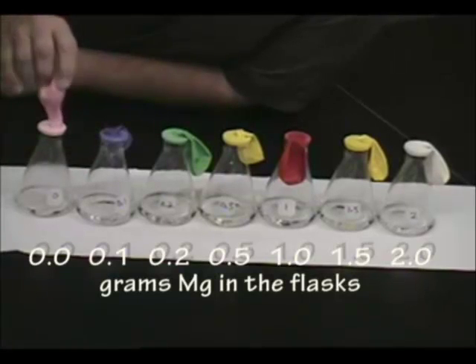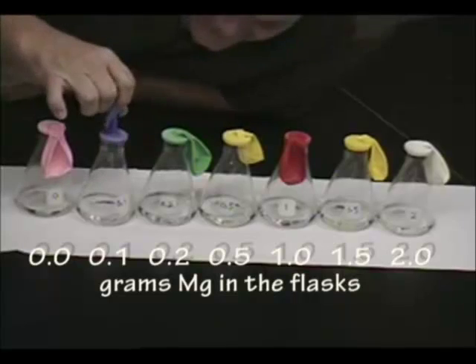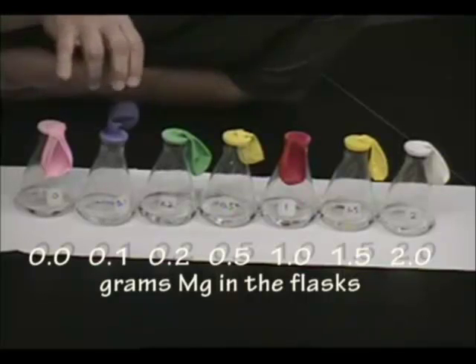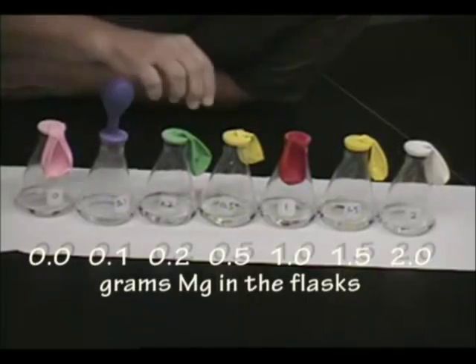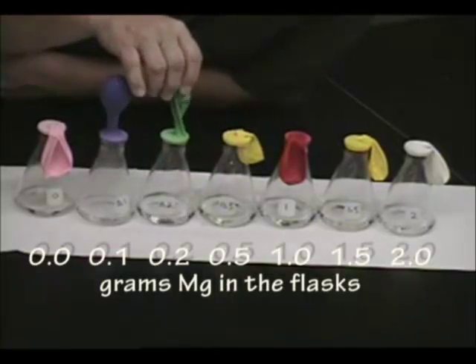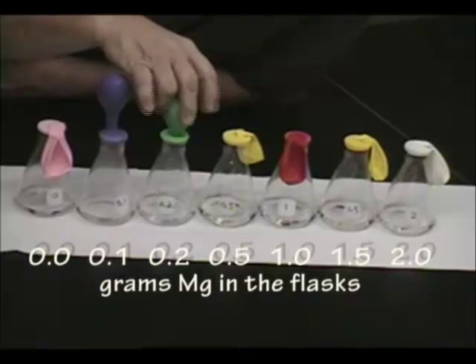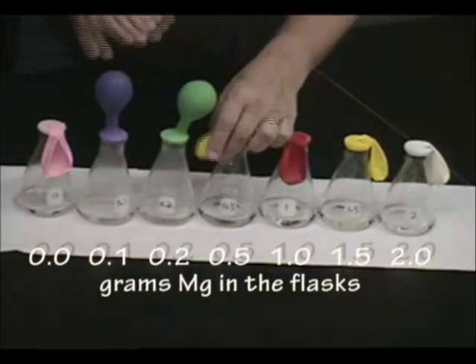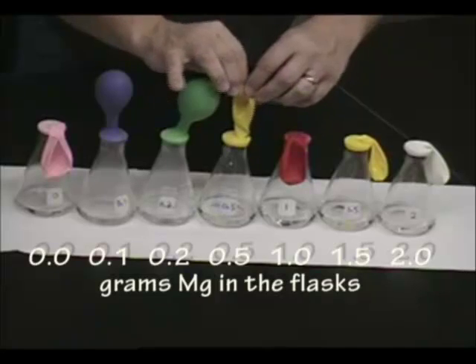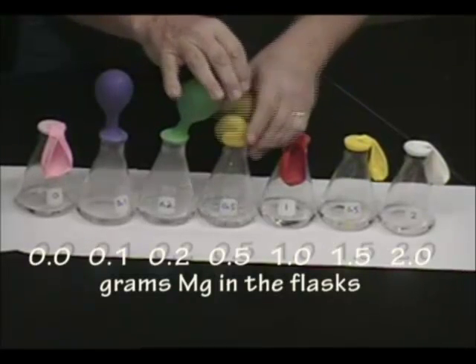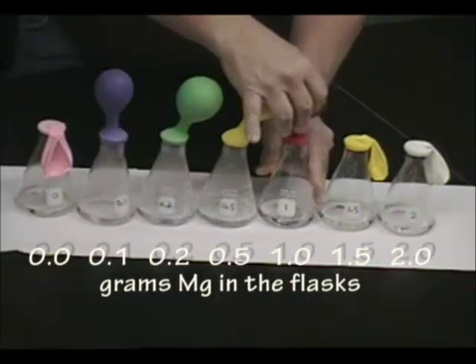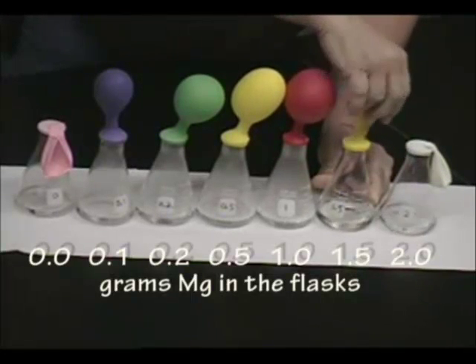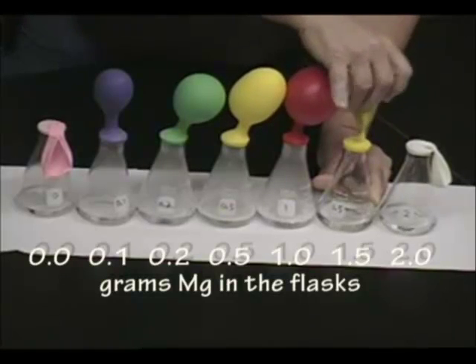So I'll dump the magnesium in the hydrochloric acid. Okay. There's a tenth of a gram. You can see it going, can't you? What I didn't tell you was the fun part, which is that when magnesium reacts with hydrochloric acid, it makes what? I'll let you think about that for a minute.